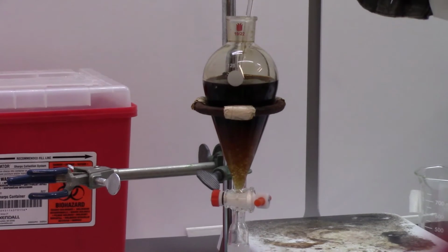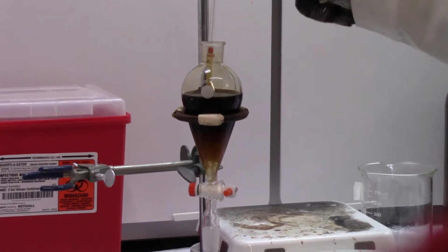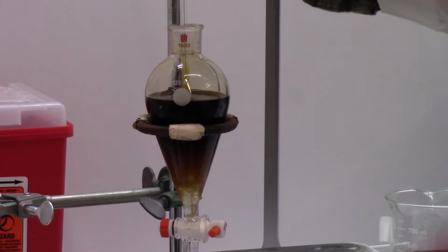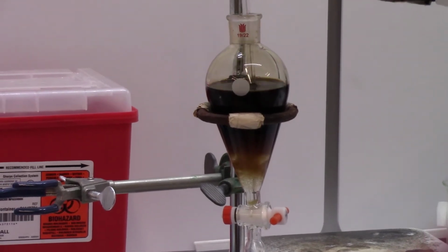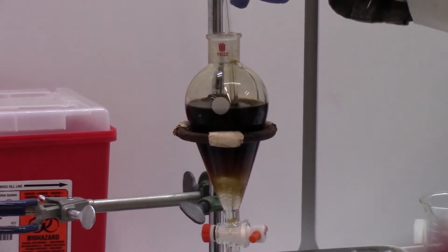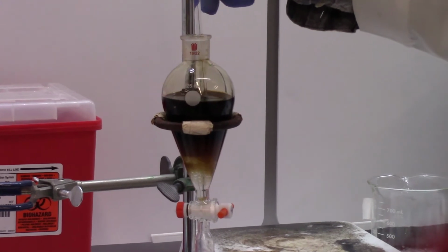Again, you can see bad emulsions over there. Now you can use the same technique that you did before. You use a glass rod to break the bubbles. You can use a circular motion to make sure you break the bubbles. It helps, and swirling also helps, and agitation with the glass rod certainly helps, as you can see.